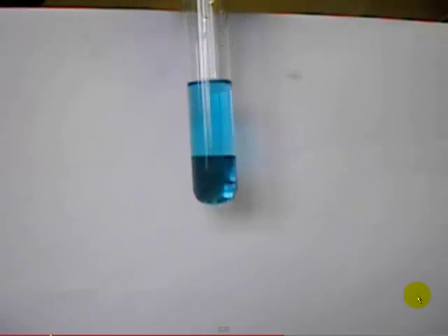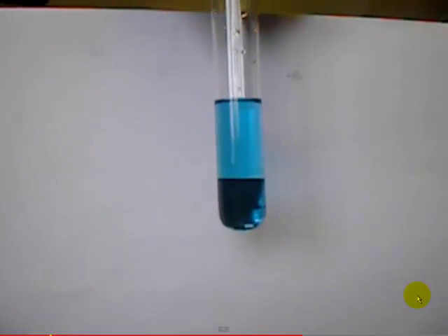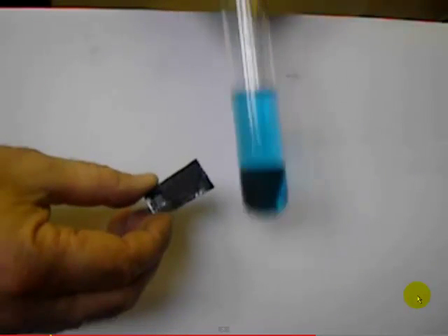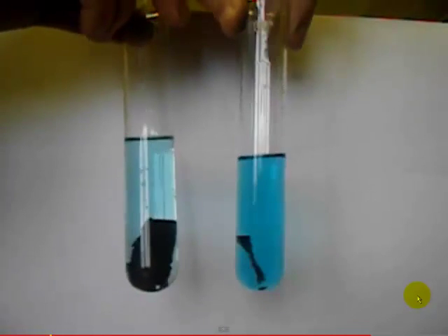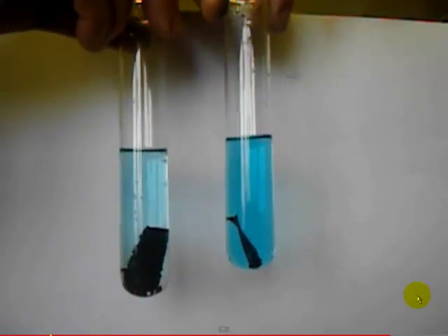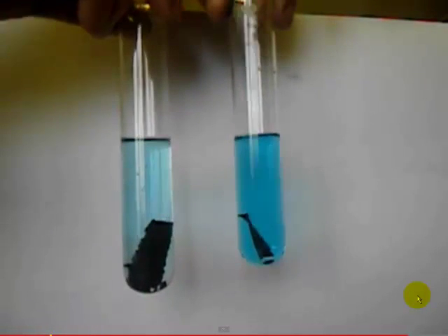You can see the surface darkening. Here's one produced a little earlier — a black deposit has formed on the surface. After some time, you can see the color of the copper sulfate begins to fade from blue, and it will eventually form a colorless clear solution of zinc sulfate.